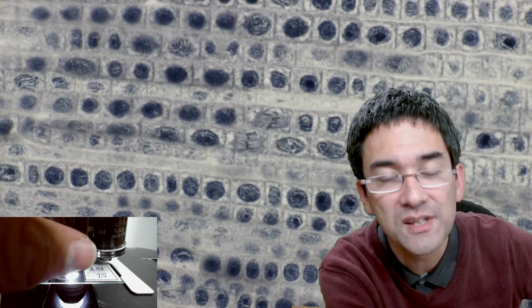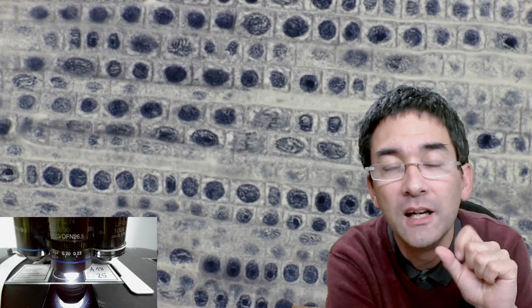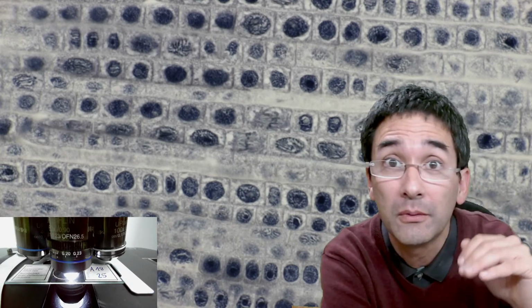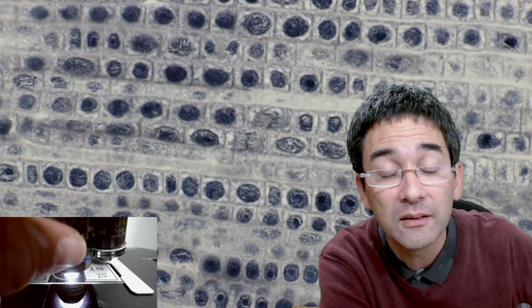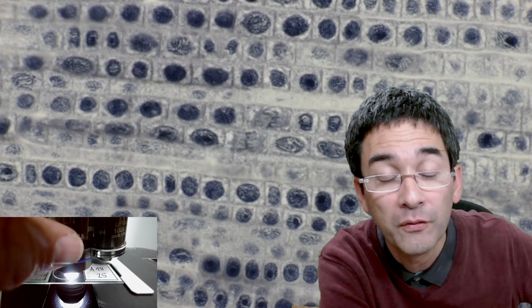This is not focusing, but this correction collar adjusts for the thickness of the cover glass. Not all cover glasses have the same thickness. There is a certain tolerance, or maybe also a thickness in the mounting medium, for example. It also counts towards the cover glass, and by turning the correction collar I'm able to adjust it in such a way that I'm getting the most clear image, to compensate for different thicknesses of the cover glass.